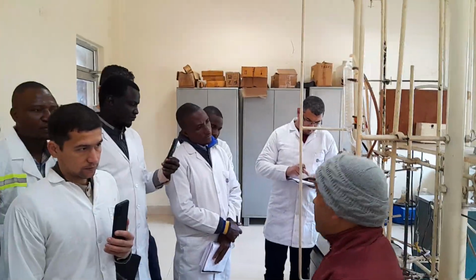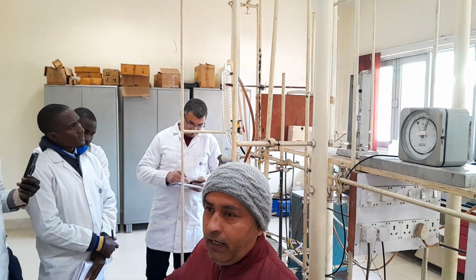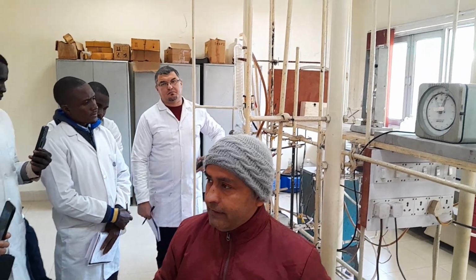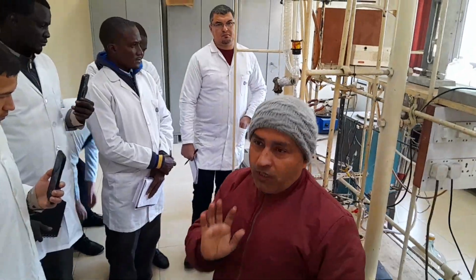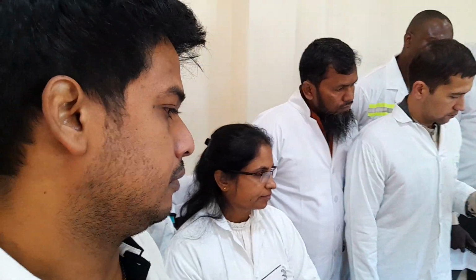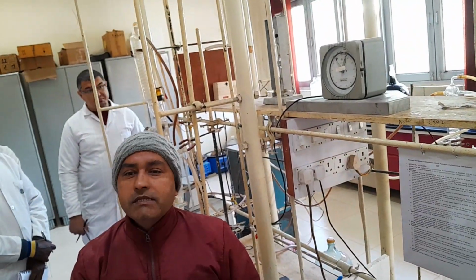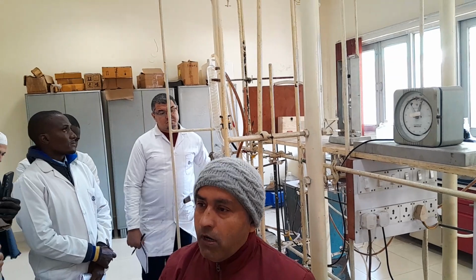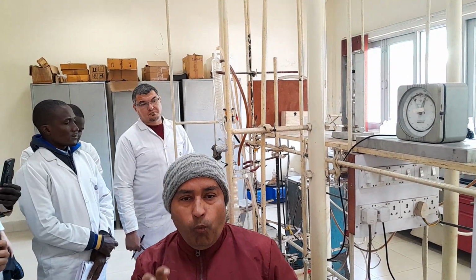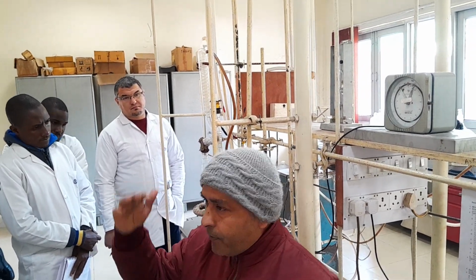Otherwise, what will happen if you directly pour that lighter hydrocarbon back inside the hot crude oil? It will again evaporate. So I will wait for at least 24 hours. Then the next day I will pour my lighter hydrocarbon back inside the dry crude oil, then again wait. So there will be a material balance. Is there any loss? Obviously there is a loss from removal of C1 to C4. Now here you will come to know what the potential of C1 to C4 inside the crude oil is, and the composition you are going to get from the GC lab.